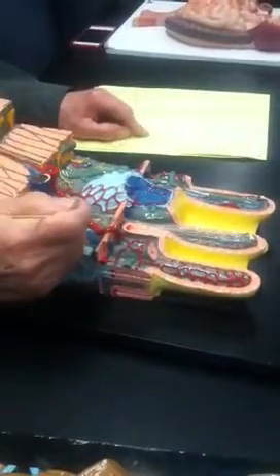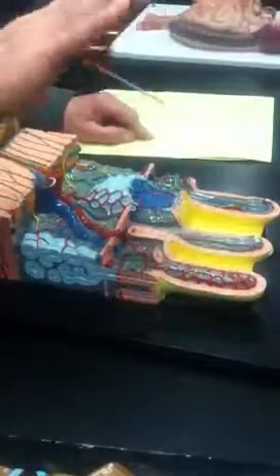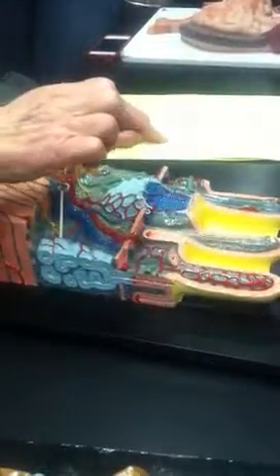Now, this is very interesting. The muscularis mucosa, by its contractions and by contractions of these fibers that move up the villi, causes the villi to wave back and forth, so that as they wave, they move material. Let's say there's stuff here with a lot of glucose. The glucose starts to move in, and now there's less glucose, so less of it moves in, but by waving back and forth, it brings more glucose from out here close to it. So by waving back and forth, that contributes to the ability to absorb maximally.